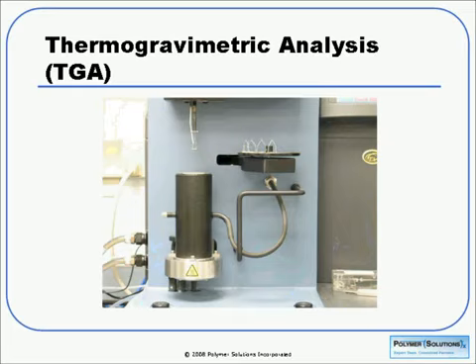Now, to switch gears a little bit, I'm going to talk a little bit about thermogravimetric analysis. DSC is usually used to look at the temperatures where polymers are processed or used. TGA usually encompasses a much broader temperature range. We usually have, again, a small sample, about 10 milligrams, and we're heating in various atmospheres, air, nitrogen, or other gases in some cases. We can see here the TGA pan is on the hang-down wire. The black cylindrical piece is the furnace, and that would raise up and control the atmosphere around our sample.